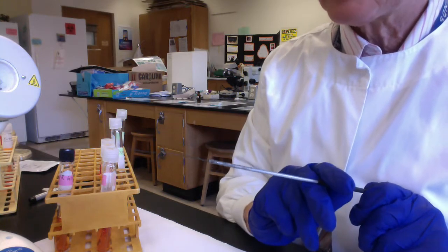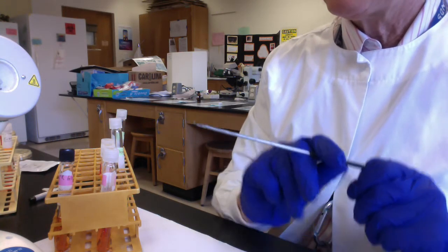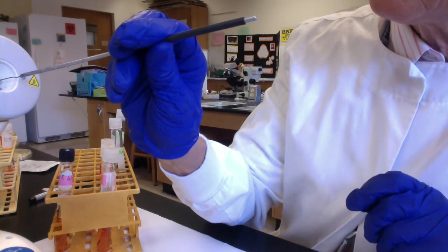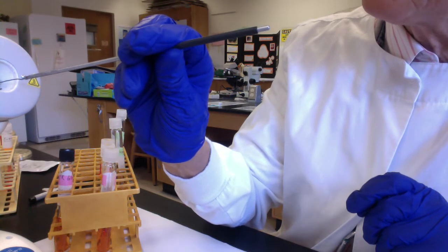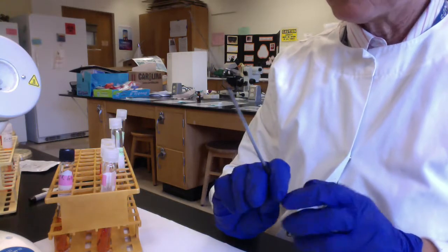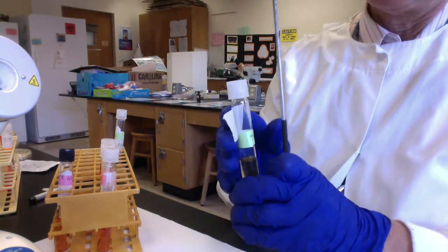The last test we're going to show you here is a test for the ability of our microbes to grow aerobically or anaerobically. So let me just go back in here and re-sterilize. And again, folks, I'll just show you how to inoculate the thioglycollate medium. Thioglycollate reduces molecular oxygen. So with thioglycollate medium, I should move this up here so you can see.